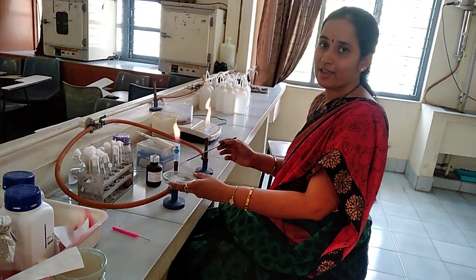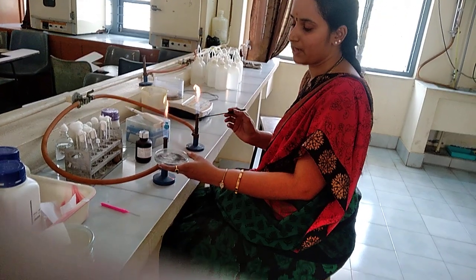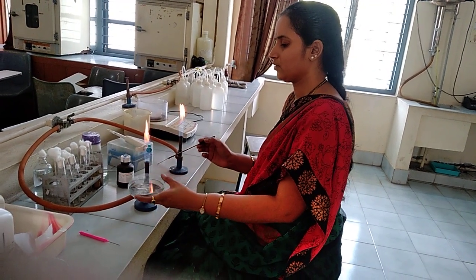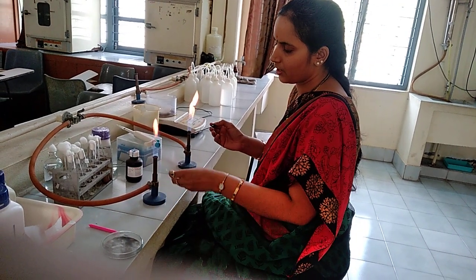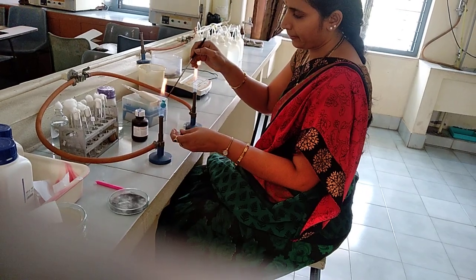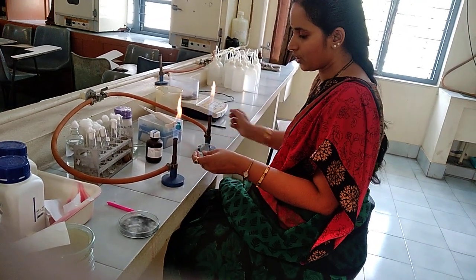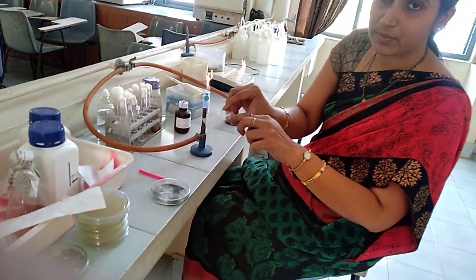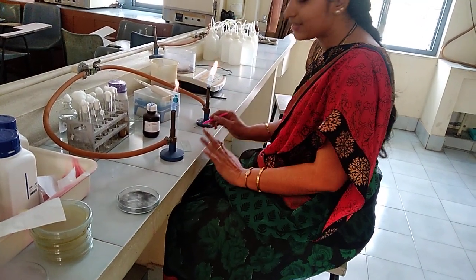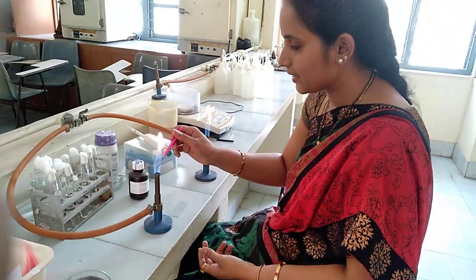Open the plate carefully near the flame. Please be careful because the spores will be released as soon as you open the plate. Slowly open the plate and take out a very little amount of culture, then place it onto the glass slide. The important step here is that you need to tease the culture and spread out the mycelium. Tease the culture using the needle — this is a crucial step. If you tease it properly, then only you can see the fungal structures very clearly.